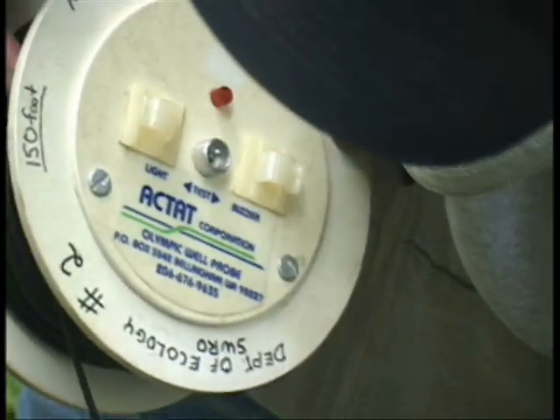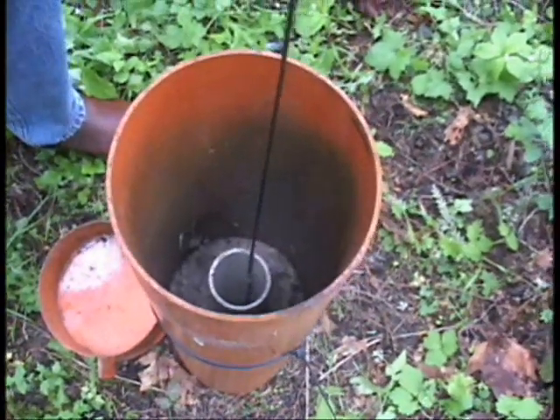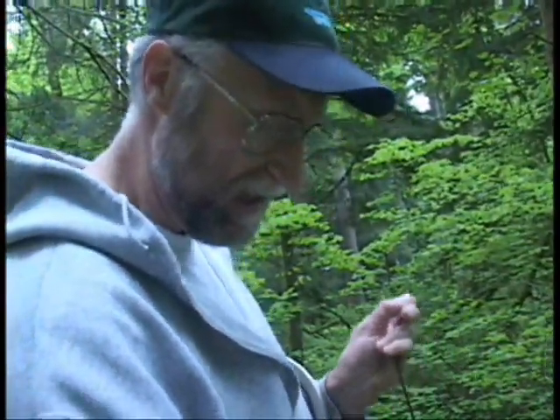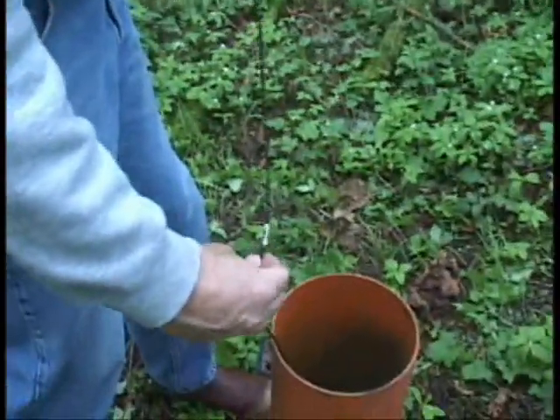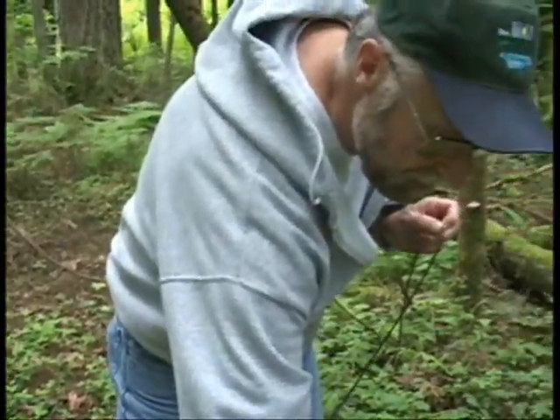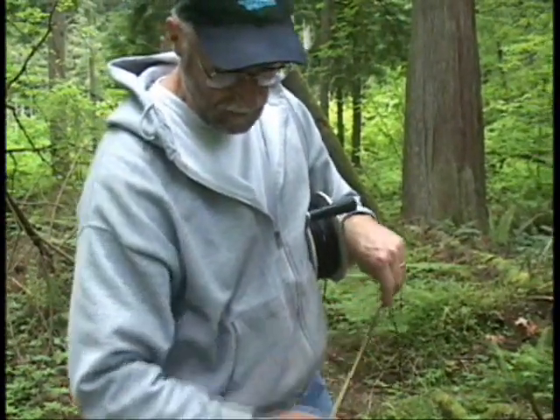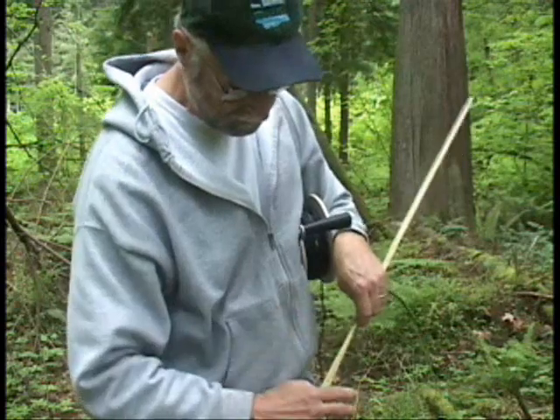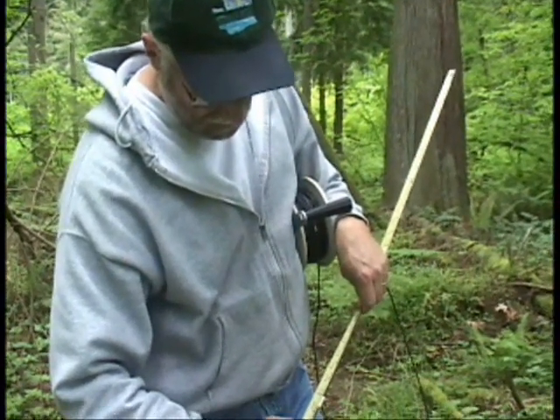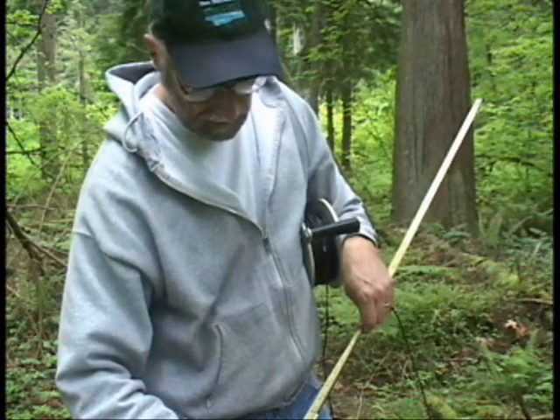The light's on. I go up. The light's off. We'll find the point. Find the closest mark. This is it. We measure that distance. This tape is marked every five feet. So the distance to water from the top of the casing is 12.57 feet.